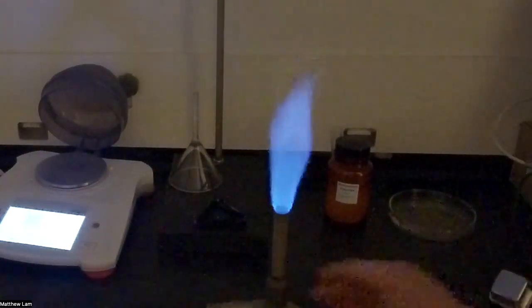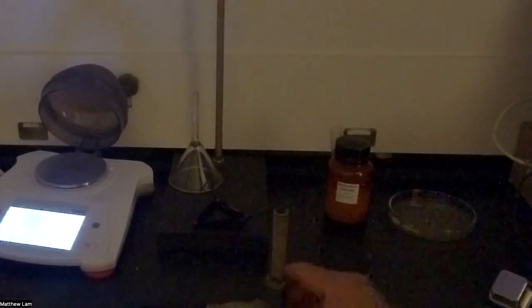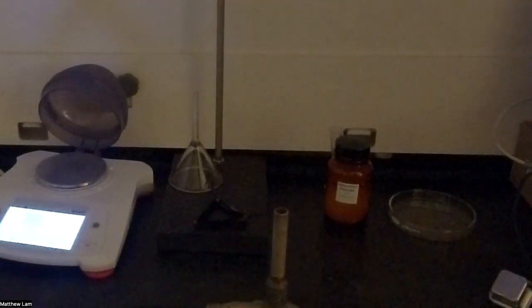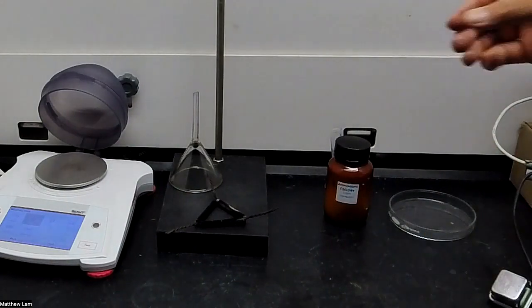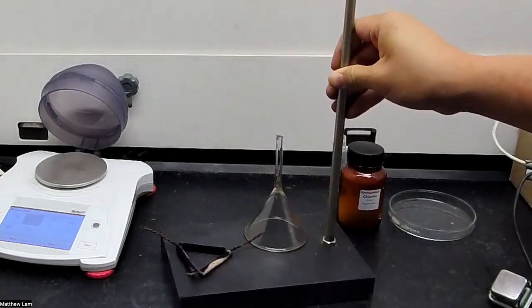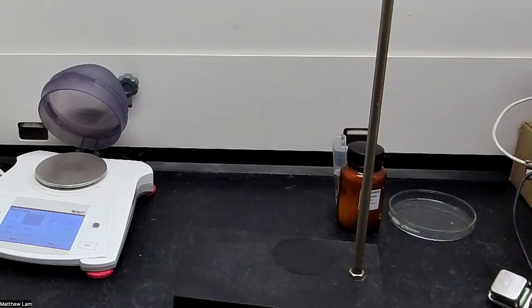So I'm going to shut this fire off for now, turn back on the light, and then we're going to set up our apparatus. Sorry for the sudden change in lighting, but we need to set up this apparatus.